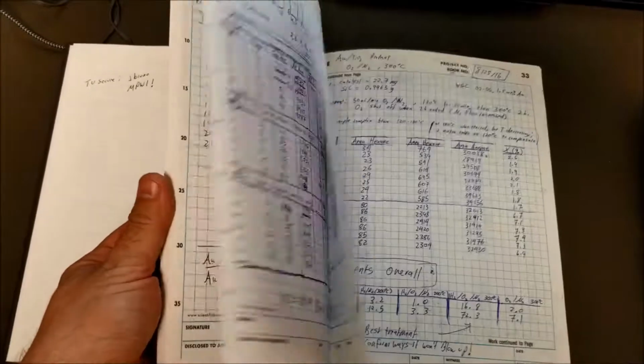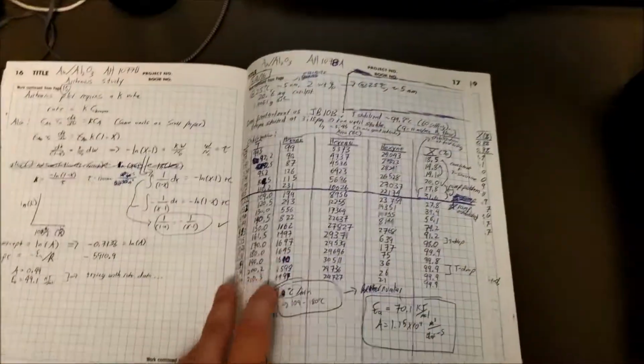Here's a guide for the lab notebooks associated with the projects that I've worked on. So first we're going to start with my notebook. You see my name here at the front and on the binding. So the first, let's say, 100 pages of this notebook are all related to hexyne hydrogenation and phenylacetylene hydrogenation.